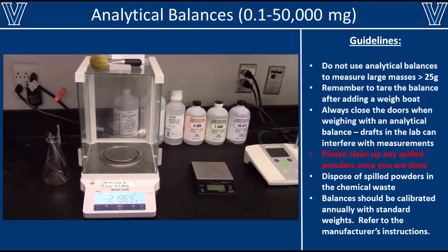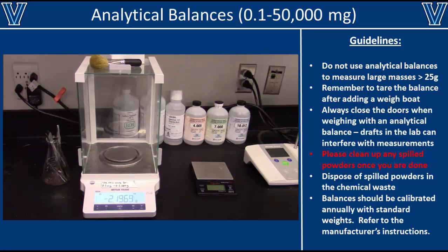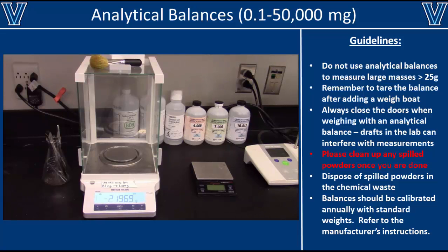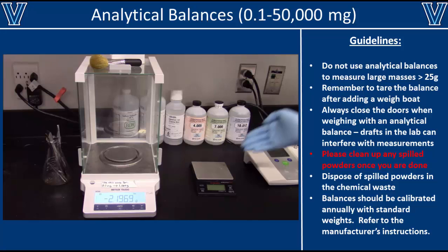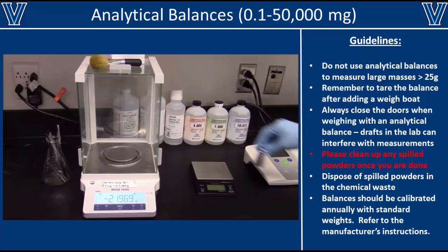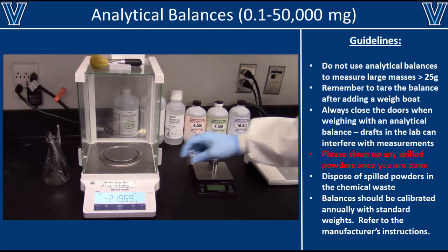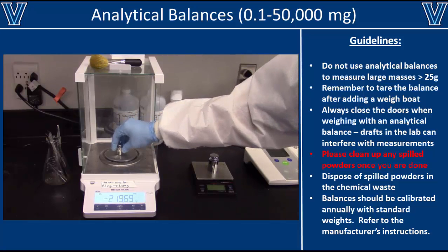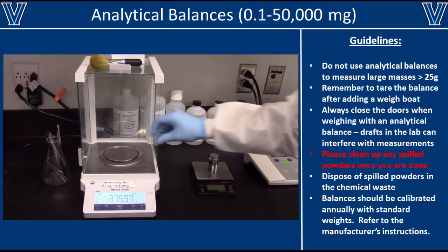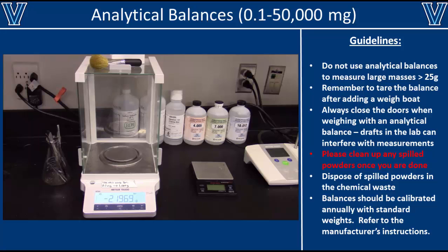In addition to transferring liquid volumes, you also have to weigh out a variety of chemicals in your research. To do so, we use balances. Most labs have two types of balances: a crude balance for large masses, and an analytical balance for very small masses. It is very important that you only weigh large masses on the crude balance and small masses on the analytical balance. This is because large masses will actually break the analytical balance, while the crude balance is not accurate enough to precisely weigh small masses.